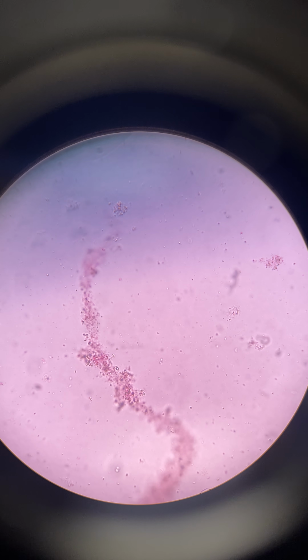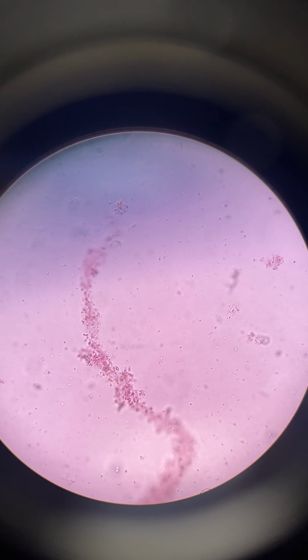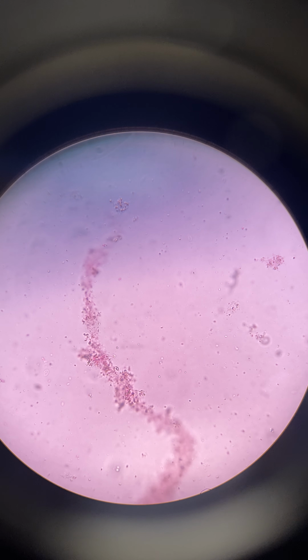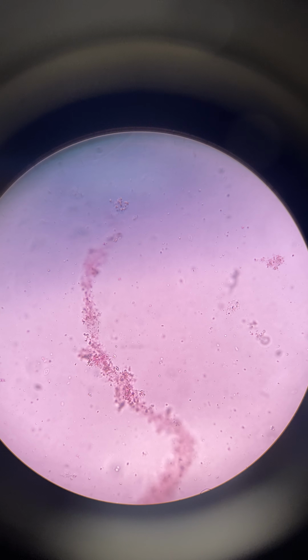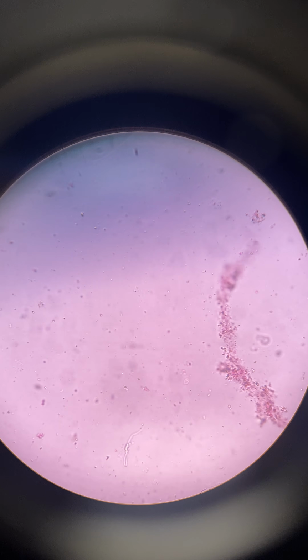It does get kind of taken over by the overall movement of stuff on the slide. So in class, I always tell students you need to wait a couple minutes for everything to kind of calm down, and then you'll see it. But you do have to look at the smaller particles. You notice this big clump of stuff that's kind of squiggling across the screen there is not doing it, but the little particles are doing it kind of subtly, but they're doing it.